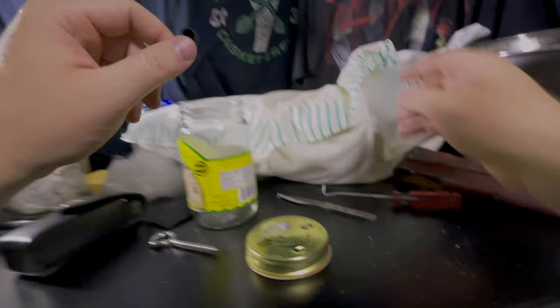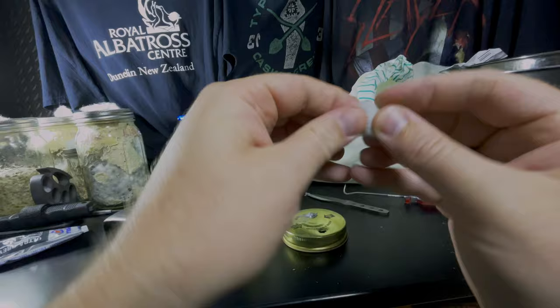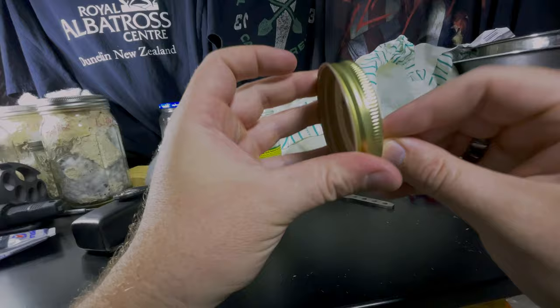Right, but back to this. Let's finish up this one jar lid. So you don't even take very much. Just grab some pillow stuffing. I try and ball it up so that those frizzy bits hopefully get mostly mixed up in there, because they're kind of annoying. And then just feed it through.